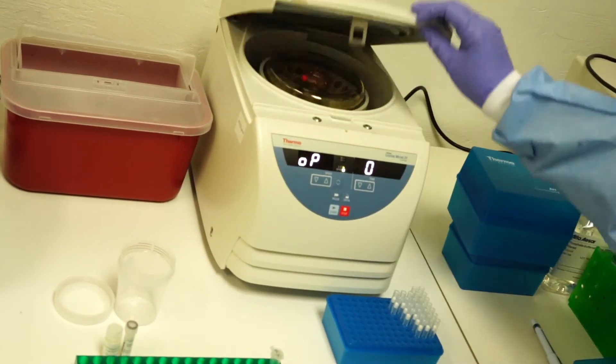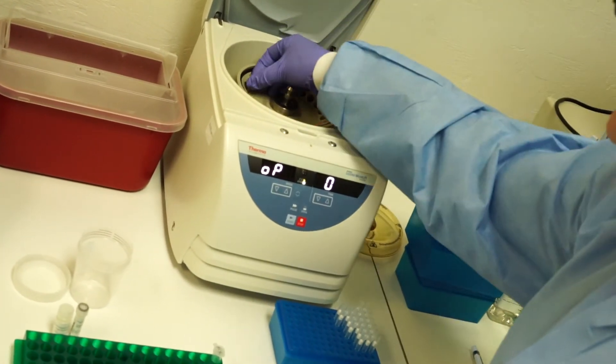Once centrifugation is complete, open the centrifuge and remove your sample tubes carefully.